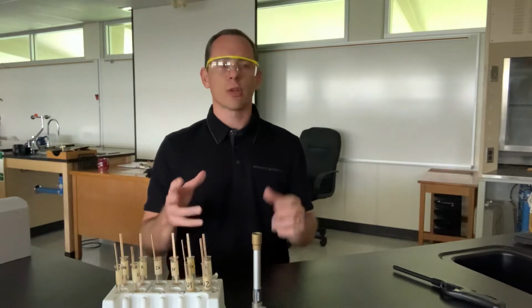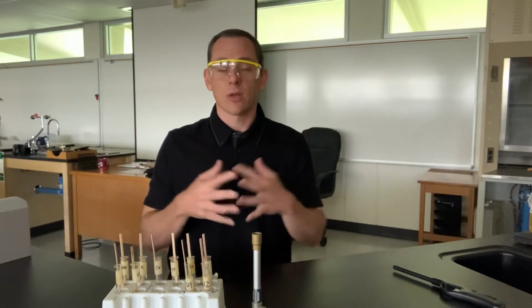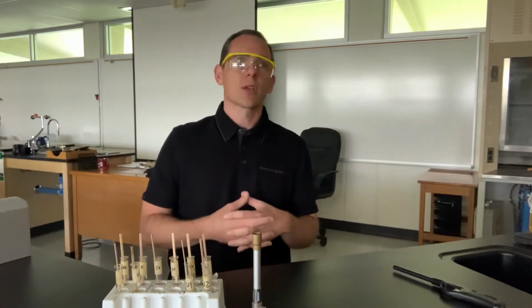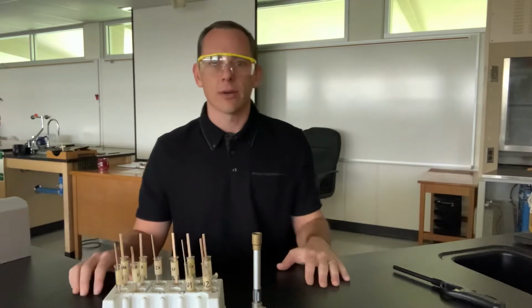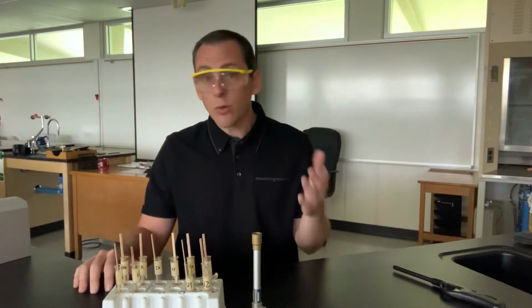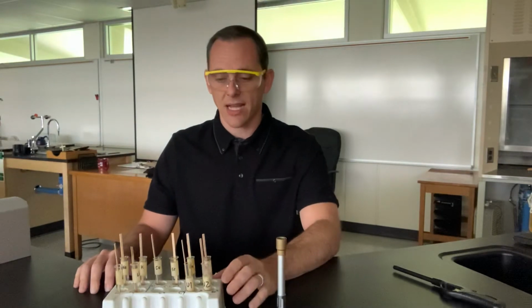And in the stock room I showed you guys how UV light can excite the electrons in certain atoms, causing them to emit light, like the atoms that we find in a highlighter and things like that. Well, we could do it really for any atom. And so I have a whole bunch of different ones here that are not gases.